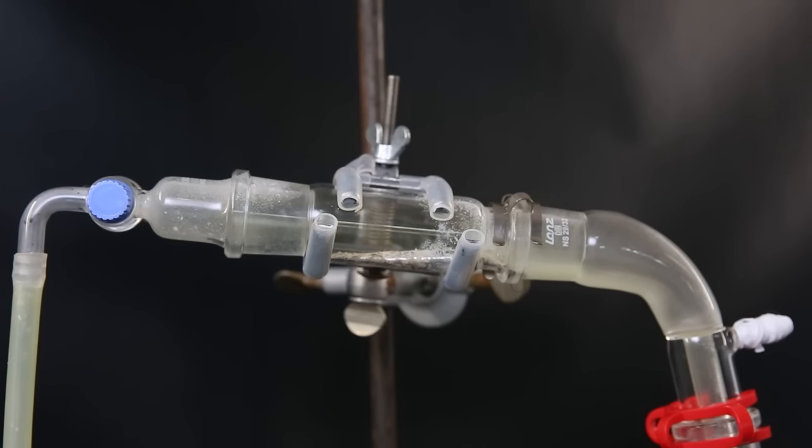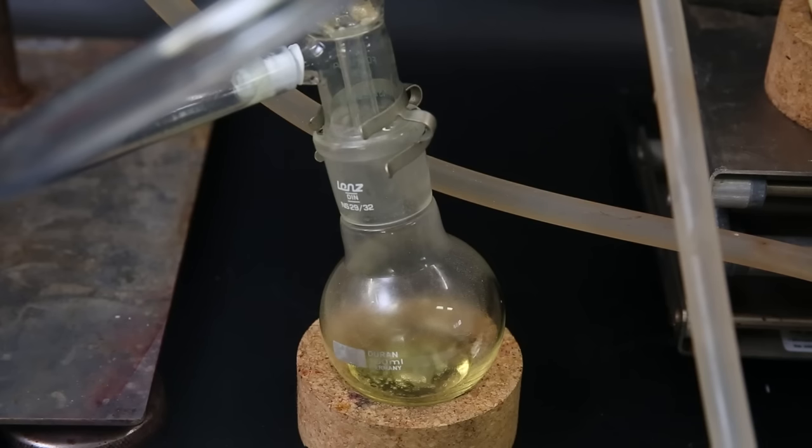But it wouldn't be a Chemaholics video without a little fail. The angle of the apparatus was tilted a little too much and suddenly the liquefied tin started flowing into the condenser and receiving flask. This caused the collected tin 4 chloride in the receiving flask to boil and part of the vapors forced itself through the trap. Luckily, it didn't all disappear. The tin that is now in the receiving flask is still extremely hot because it is reacting with dissolved chlorine, which is not the most optimal.